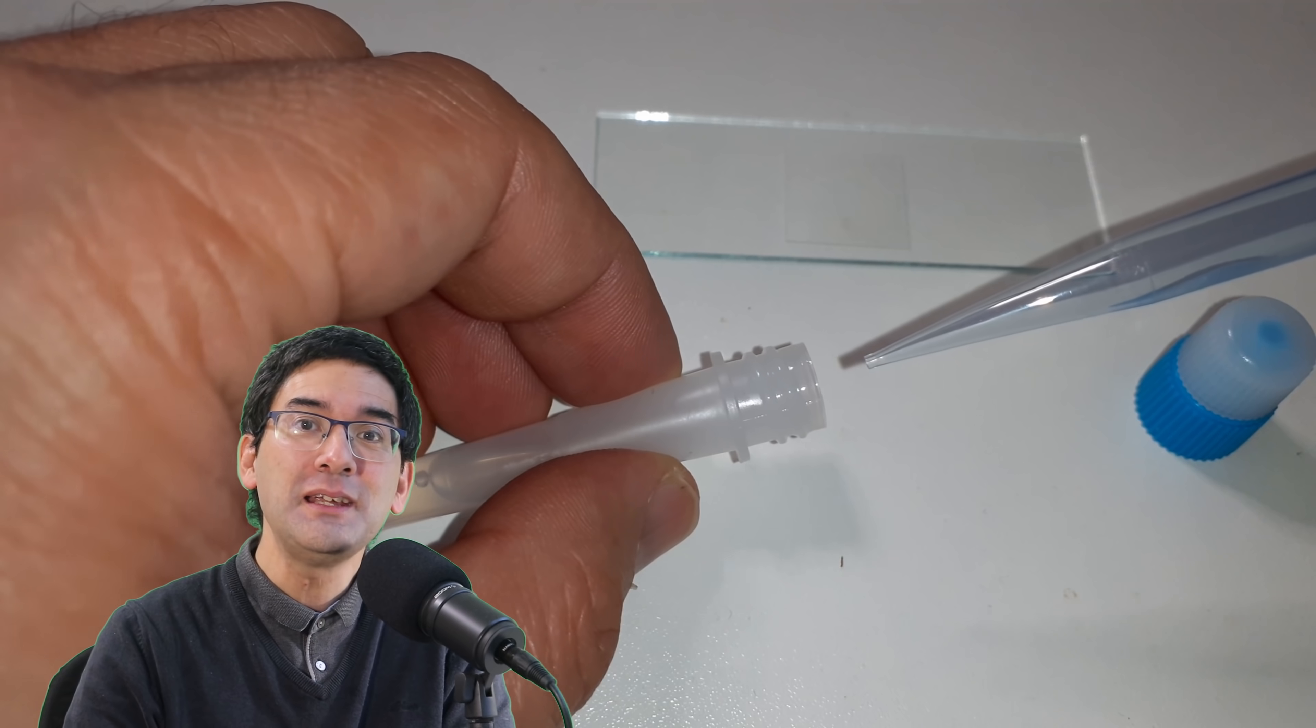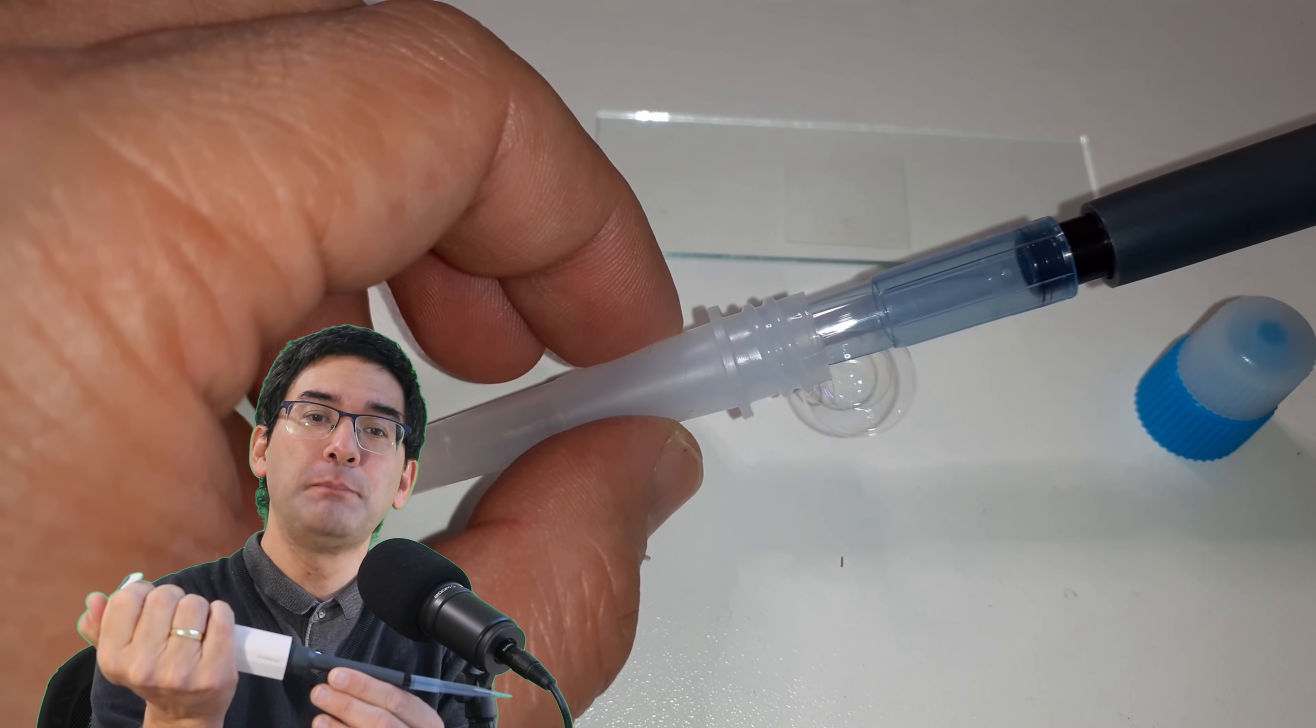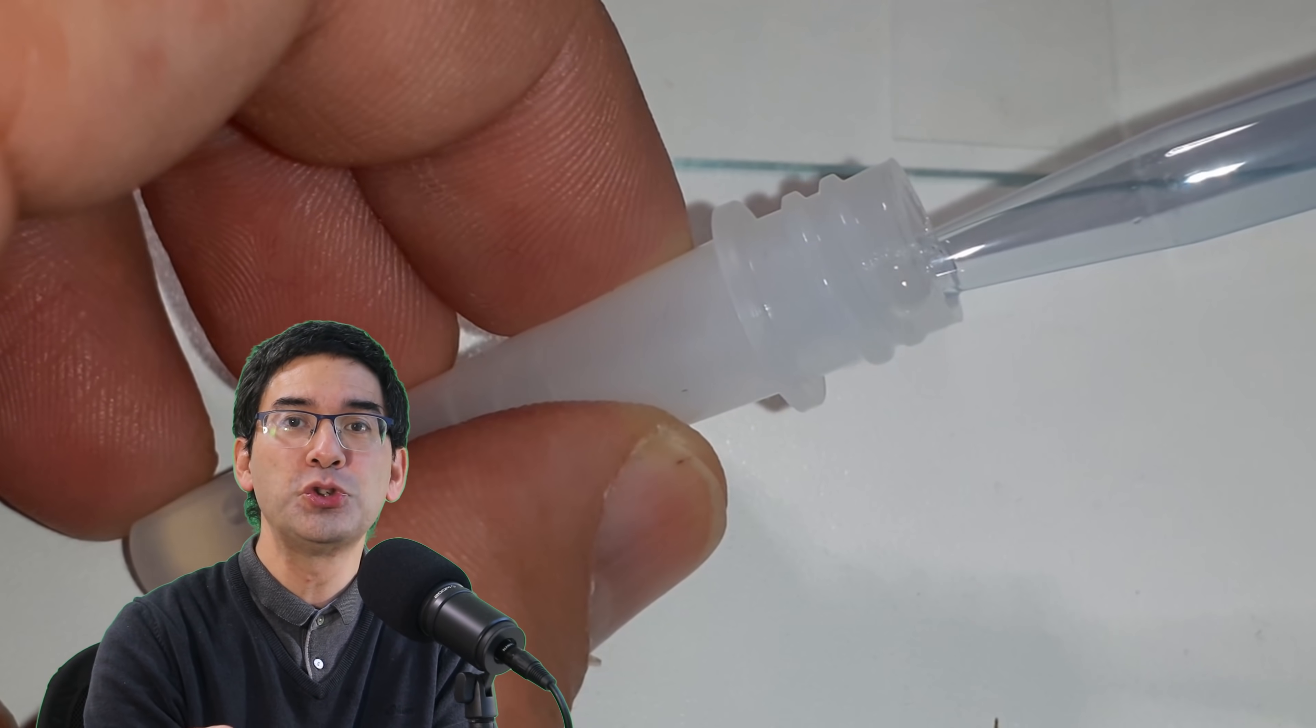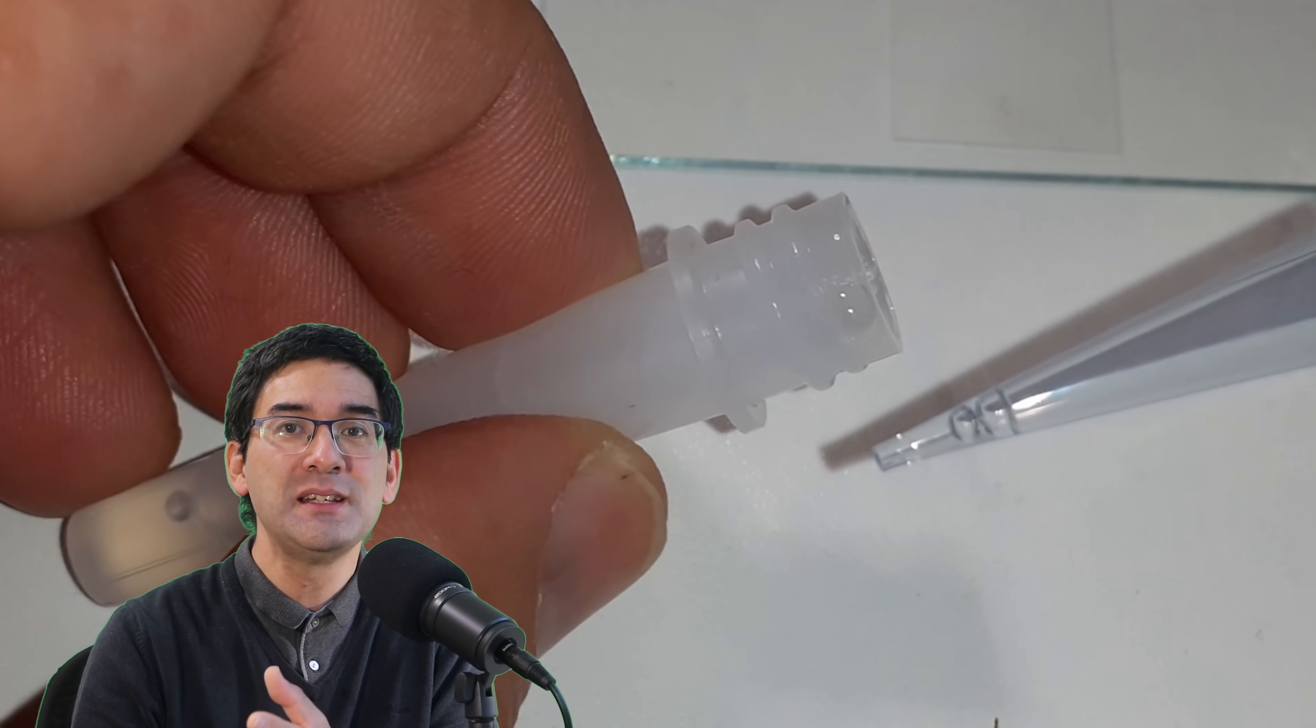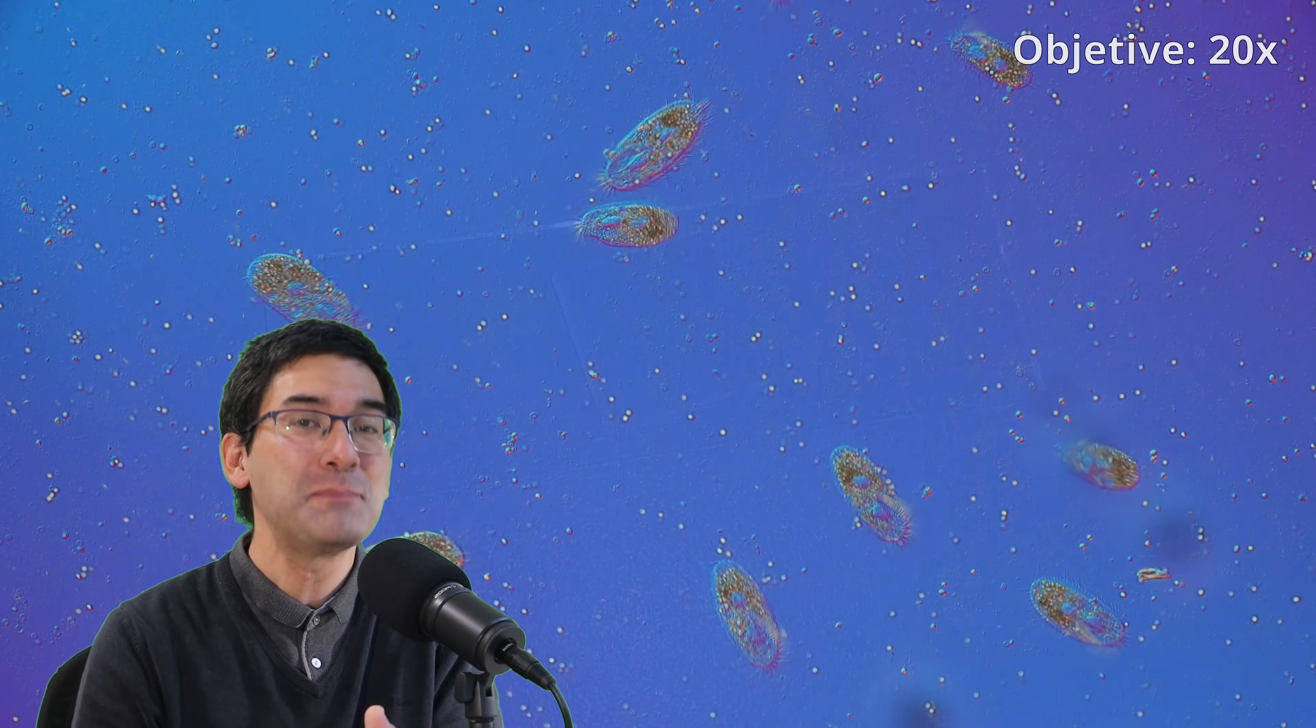I've taken my pipette, like the one I have over here - it's a microliter pipette - and taken a small amount of the buffer solution and mixed it under the microscope with a water sample which contains those ciliates. The buffer solution was drawn beneath the cover glass and mixed with the water microorganisms. Then something quite interesting, not unexpected, happened.